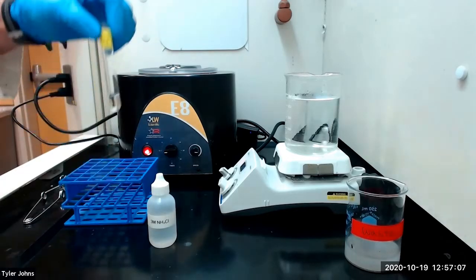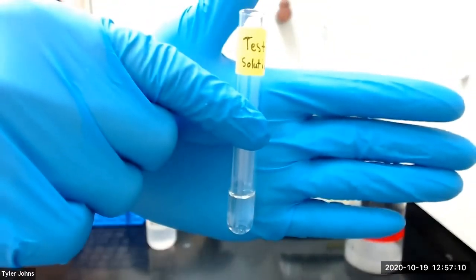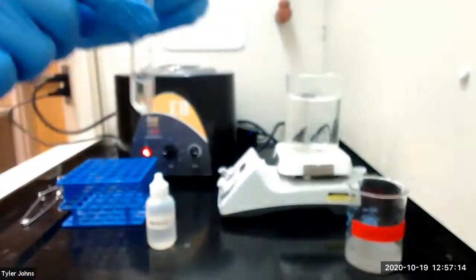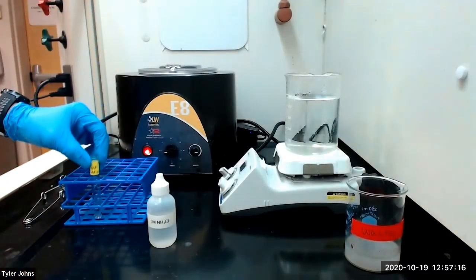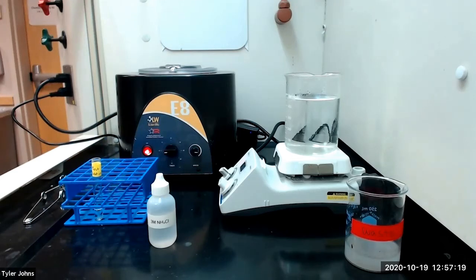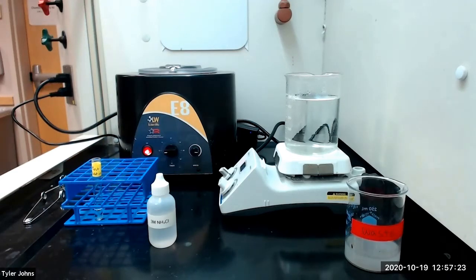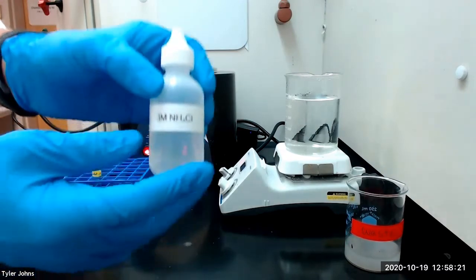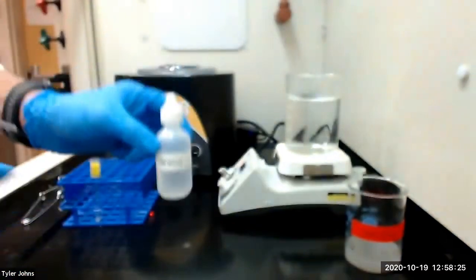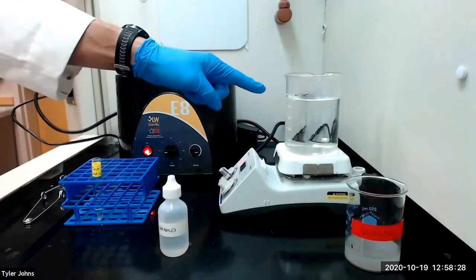We will begin this procedure with a test solution containing our barium, calcium, and magnesium ions. We could also begin this procedure with the S9 solution that would have been set aside during the analysis of the ammonium sulfide group, or group 3. We will start by adding one milliliter of three molar ammonium chloride to our sample and then heating our sample in a hot water bath.